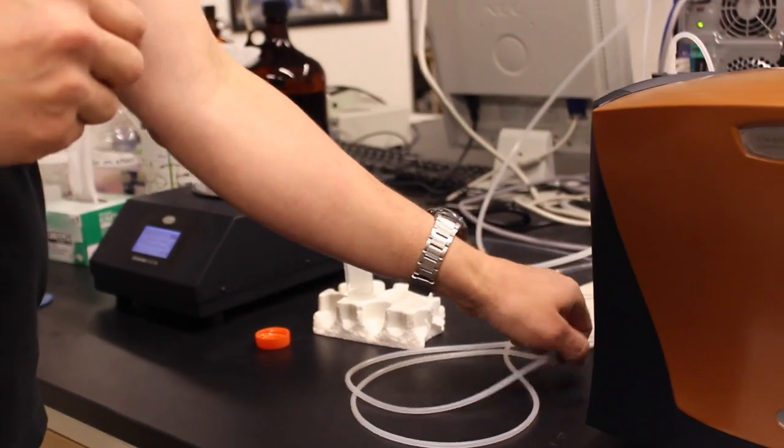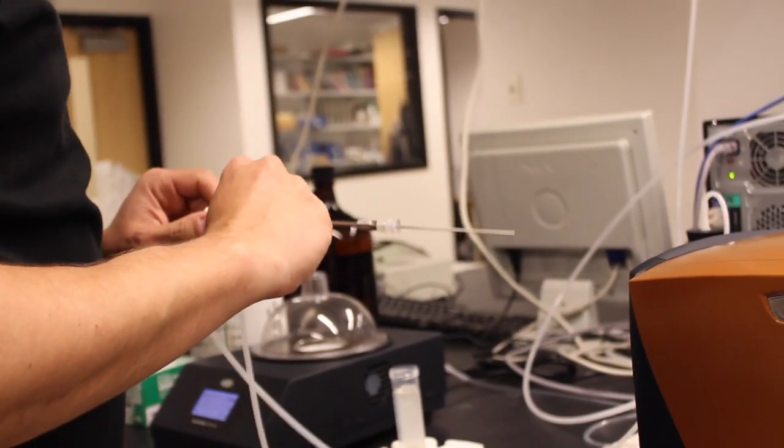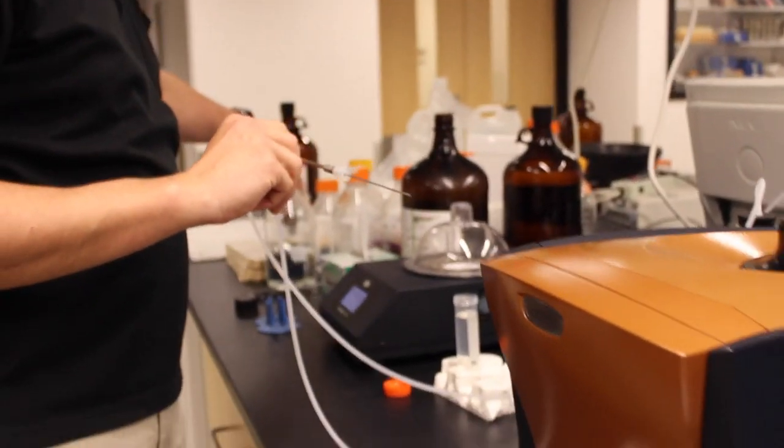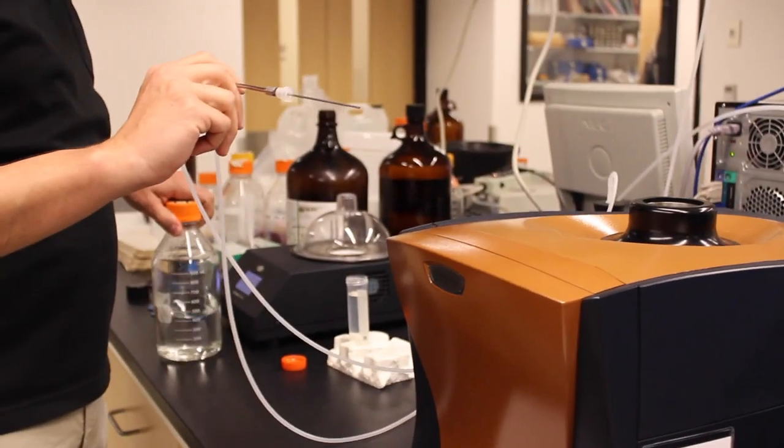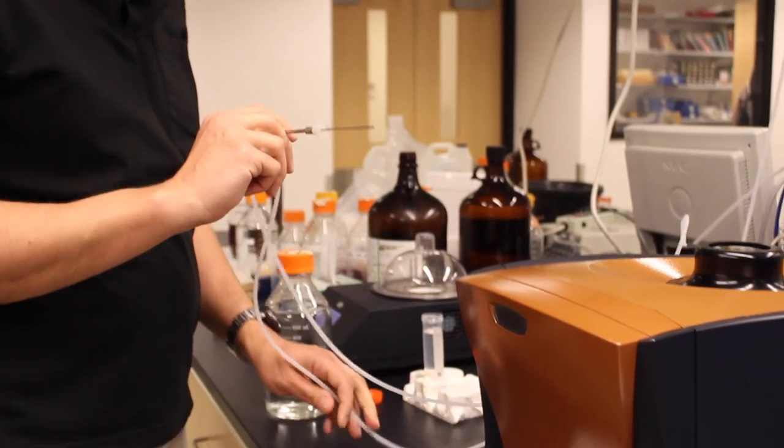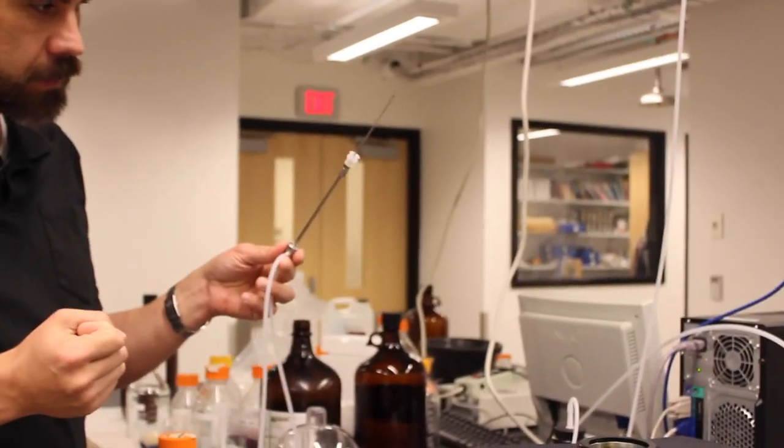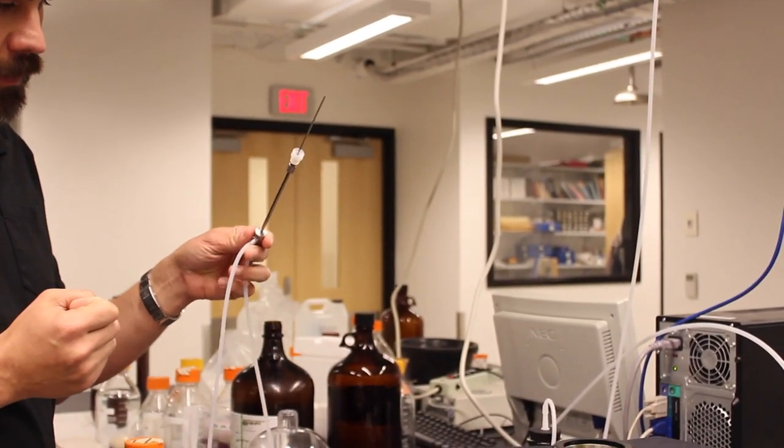If you're using detergent or if you just want to be sure that the cell has thoroughly been rinsed and cleaned, you can use this vacuum apparatus here.